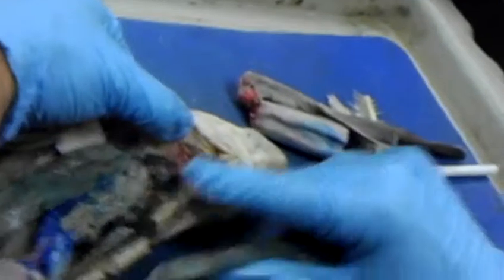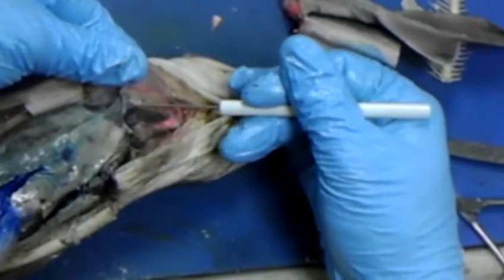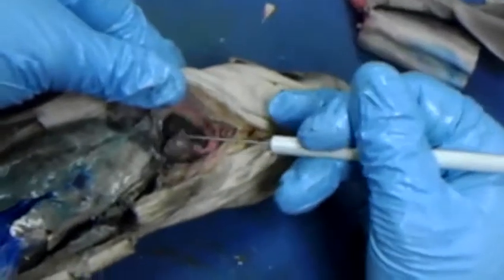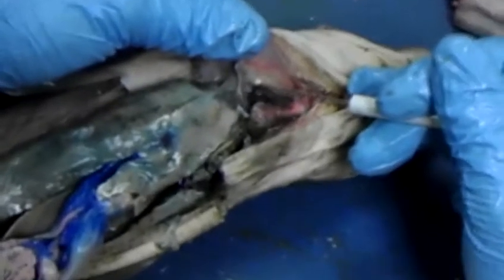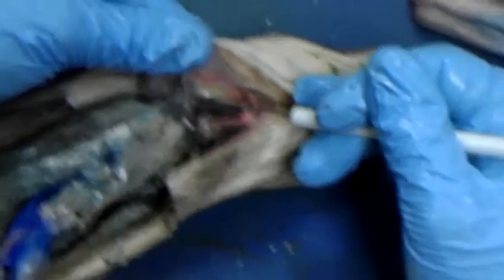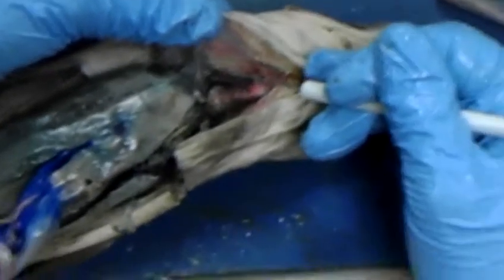All right, so now let's move to the heart. A lot of times this gets torn, but this structure here is the sinus venosus. See this real paper thin? In the artery, capillary, circulatory system world, sinus means an area without muscle. Venosus is in reference to a vessel that's doing what? Carrying blood to the heart.